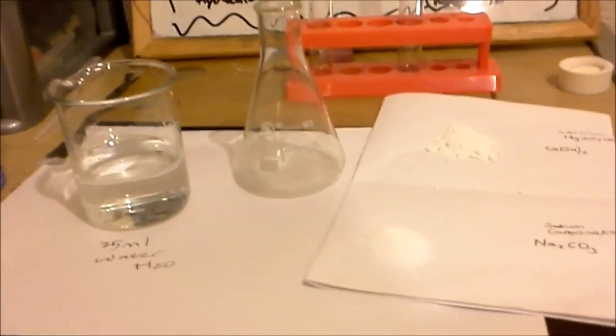We're just going to get the water, pour it in and just give it a little mix and then we'll filter it.